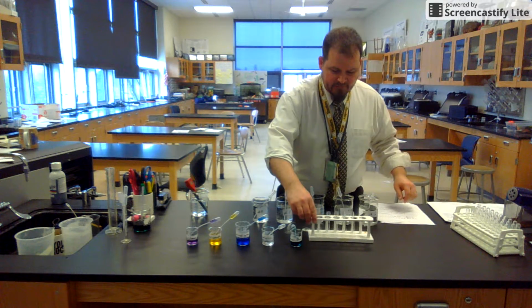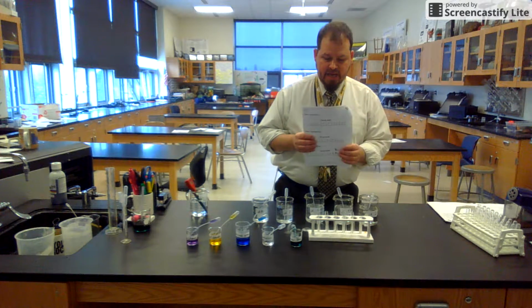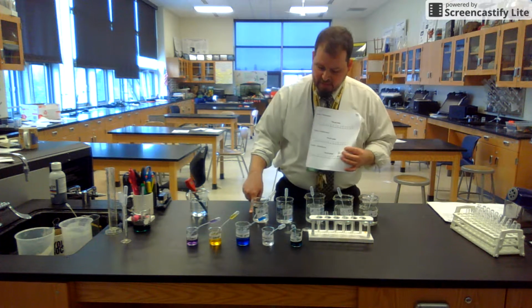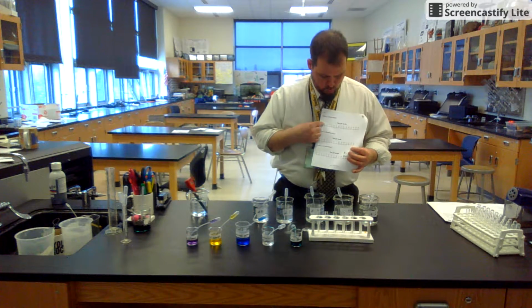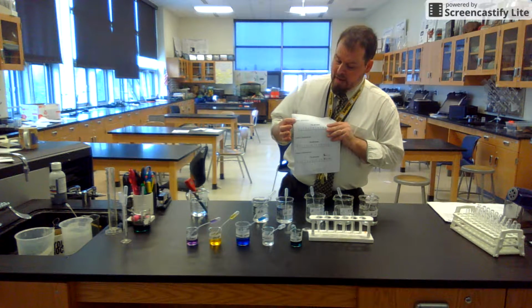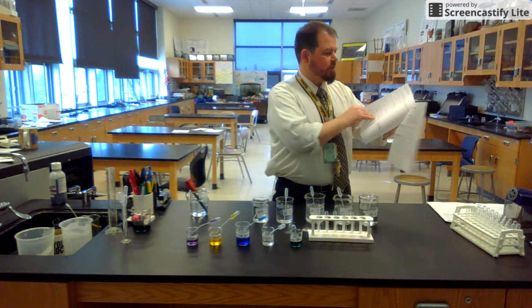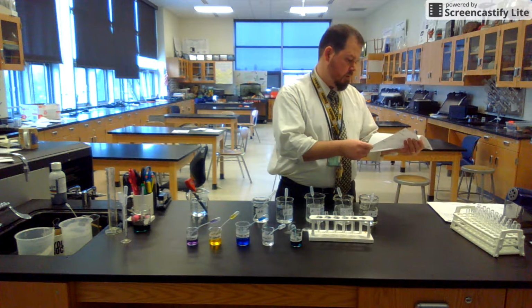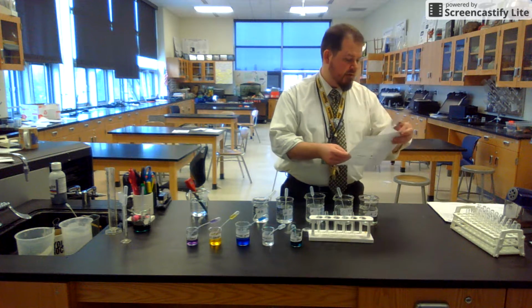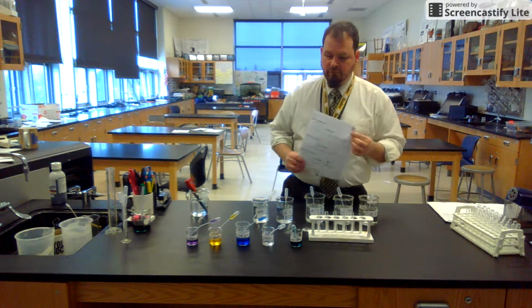You're going to need 5 test tubes. In the 5 test tubes, I'm going to test all 5 pHs with one indicator. So the first solution says to use methyl orange. I only have 6 indicators. We are going to skip over methyl blue. I don't have that, but it's also not in the lab for you to do. Okay, so the first one will be methyl orange.